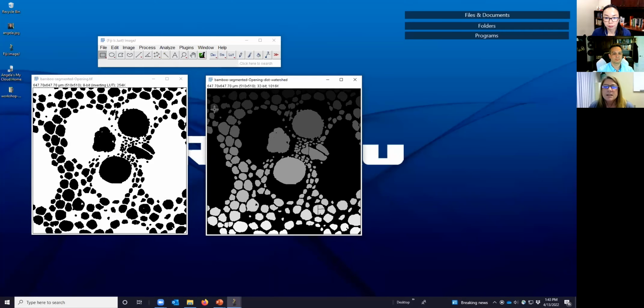Let's look at those. In the top left, we see a couple of different objects. If we look in the status window of ImageJ and hover over the top one, it says value equals 44. That's the index number for this particular object that was separated. The bottom one has value 50. So where this should be a single object, it's separated it into two. The same thing is over here in the middle towards the right. 110 is its index, and 114 is the one on the right. Instead, they should be a single object. And there are a couple of others.